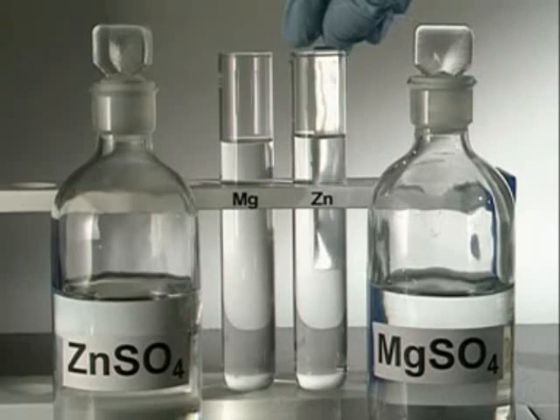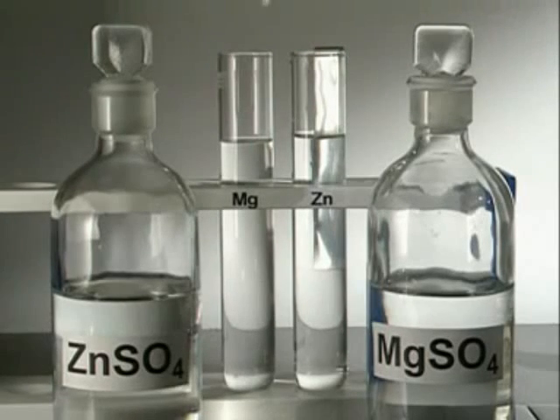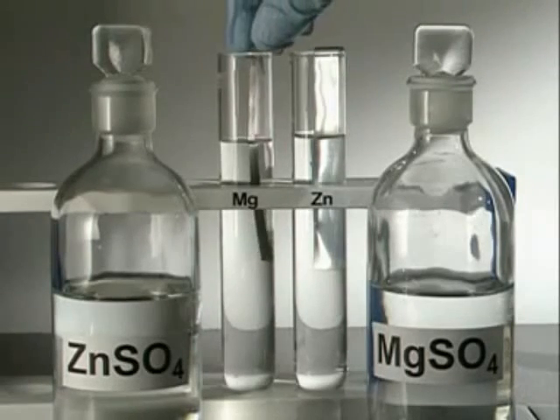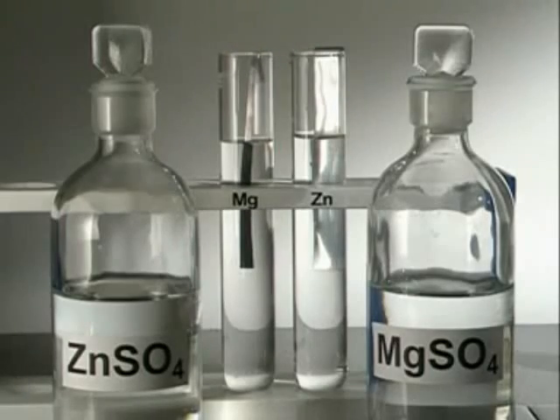Placing zinc metal in a magnesium solution and magnesium in a zinc solution will help determine which of these two is more reactive.